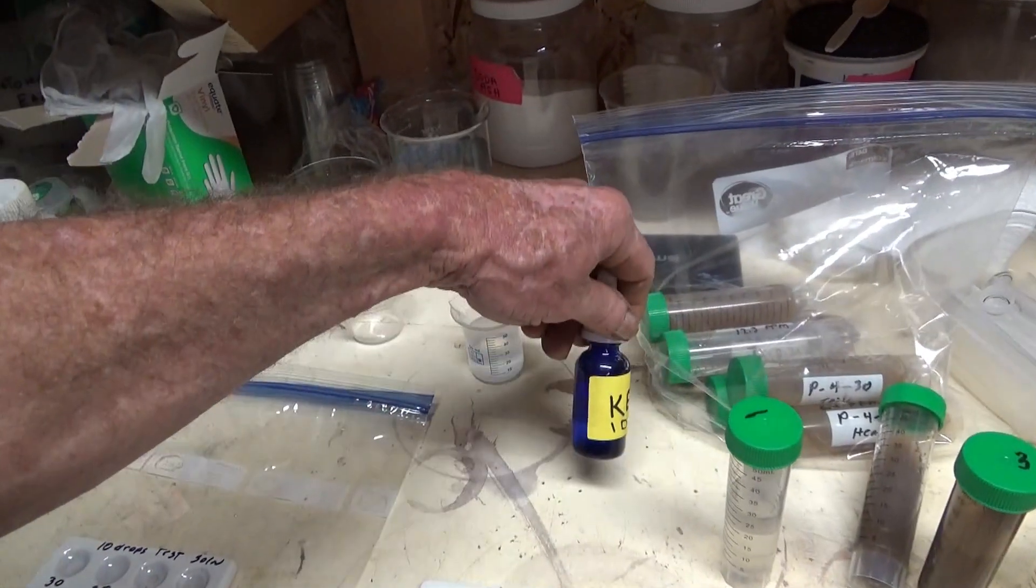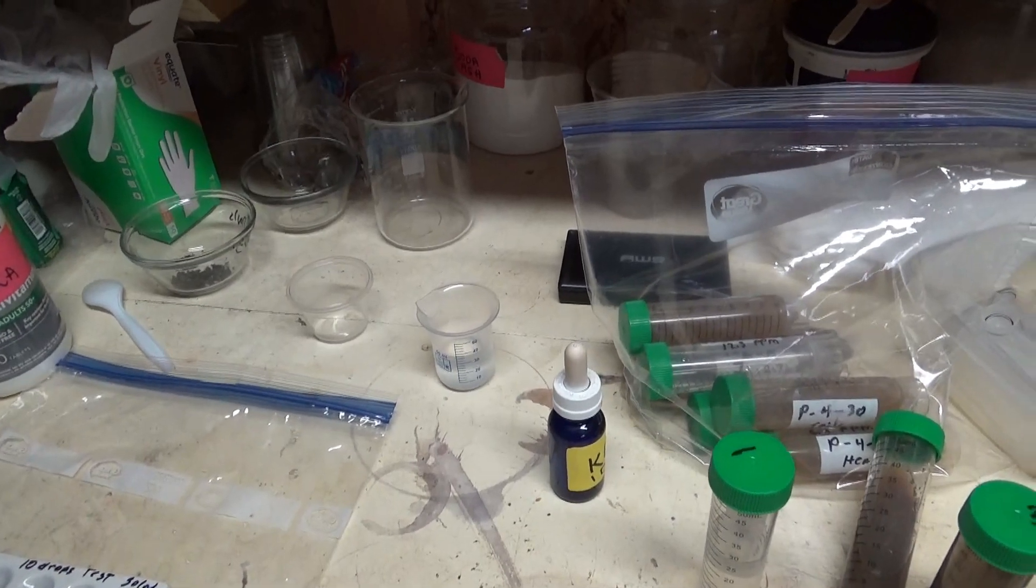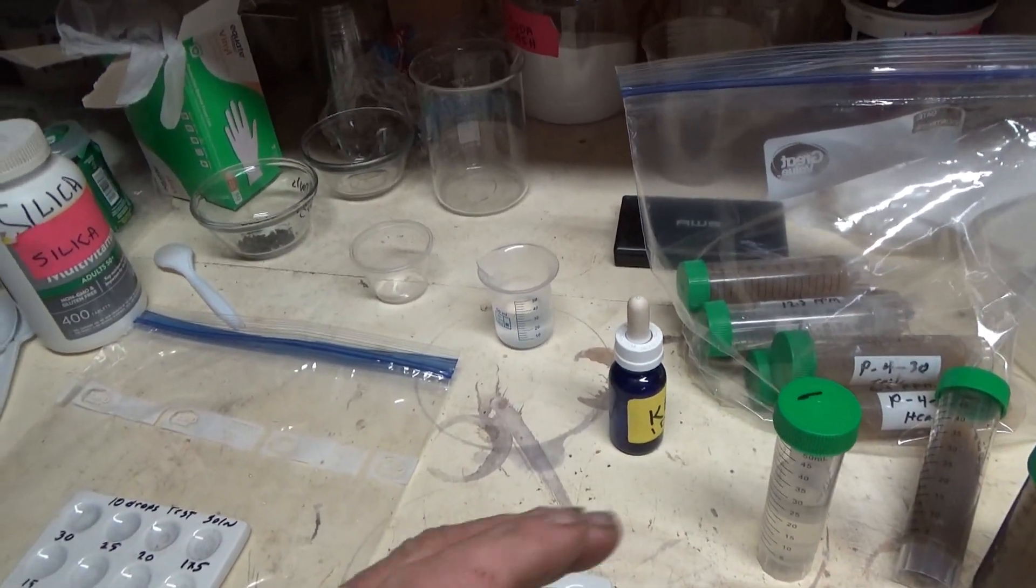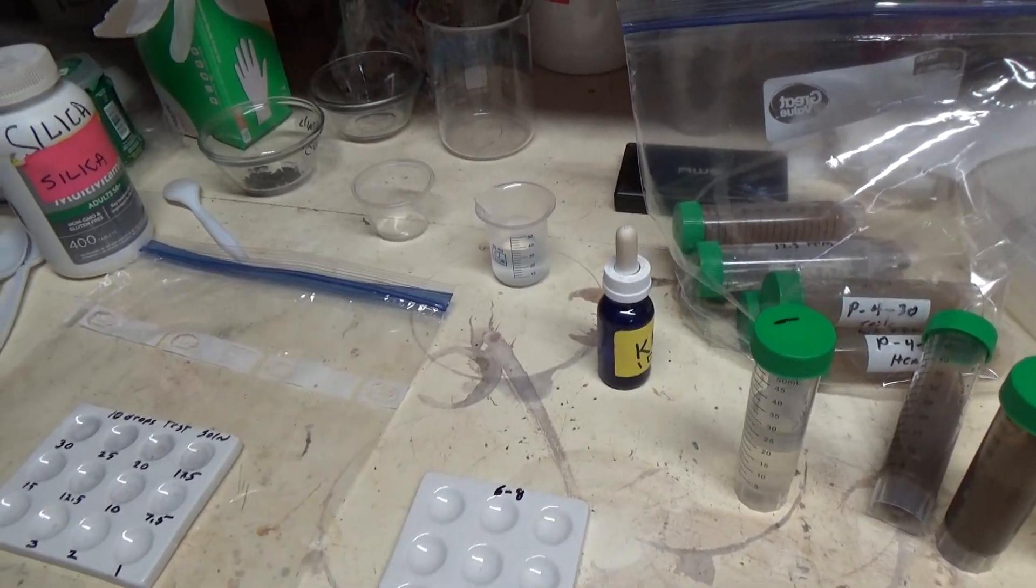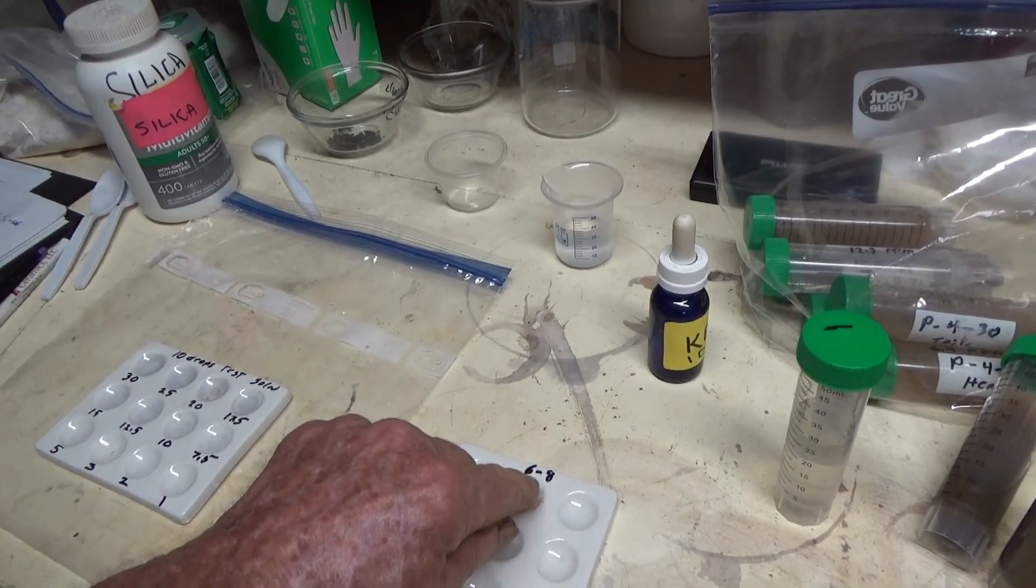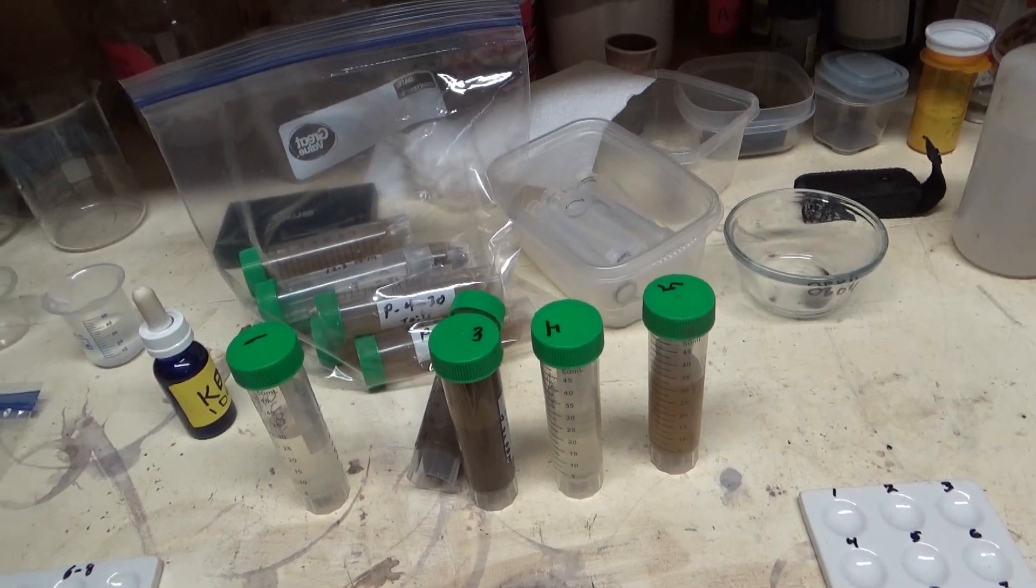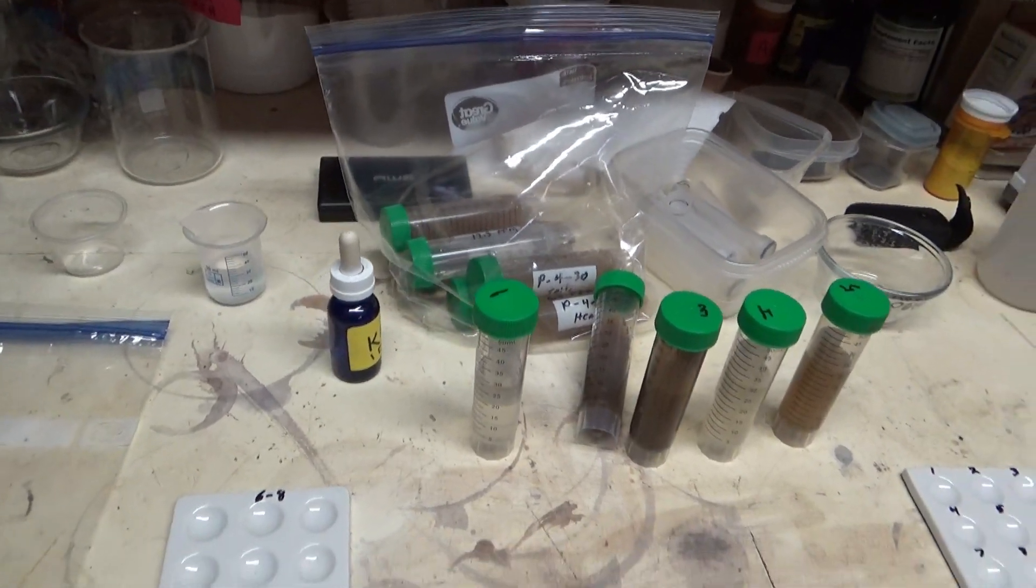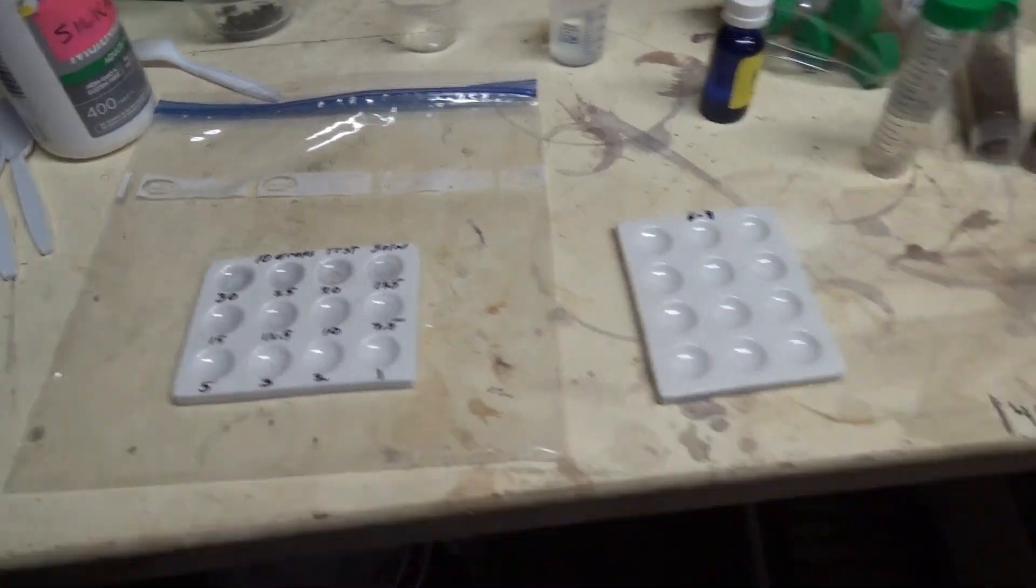This is our indicator solution here. We put one drop of that and a half a milliliter of solution to be tested in each one of these wells. In this case we're only going to be doing one. This is an actual test from today and these are the ones that are here, and we started with the solution right here.